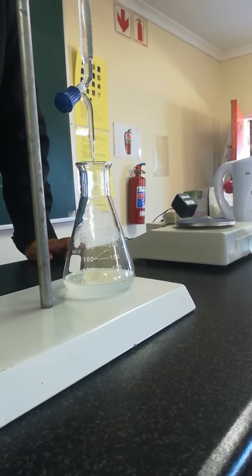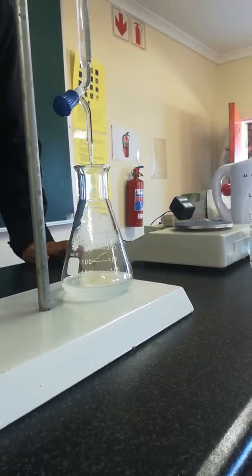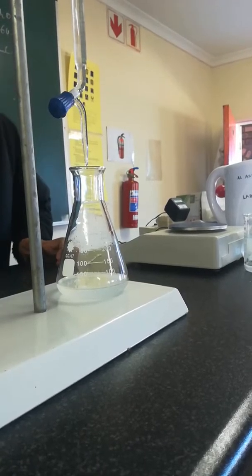This is the volume of base that neutralized the acid. It's actually 16, 17.1. It hasn't yet. Now we're trying to be safe.